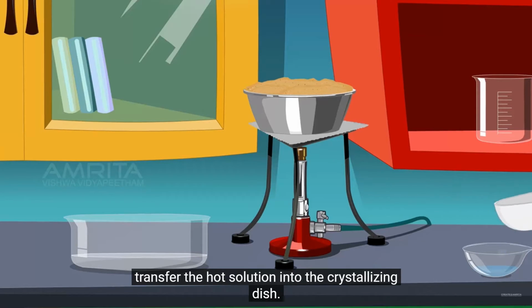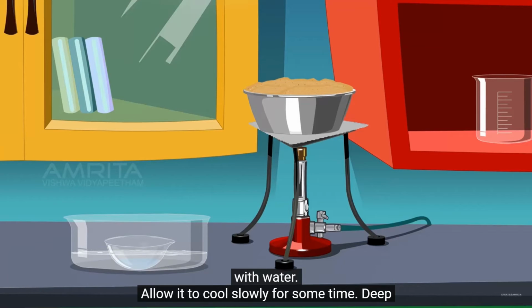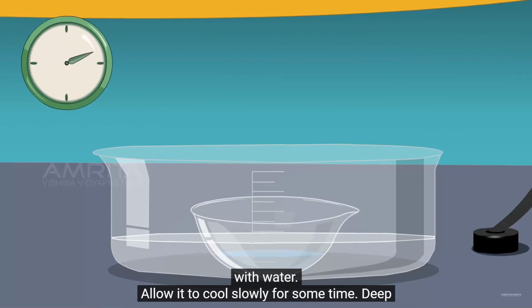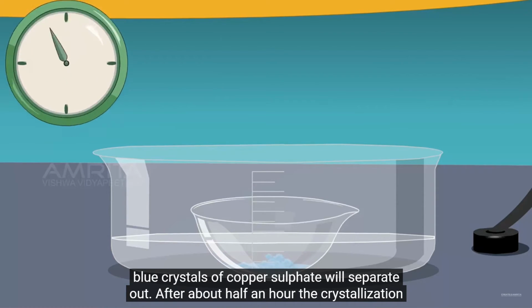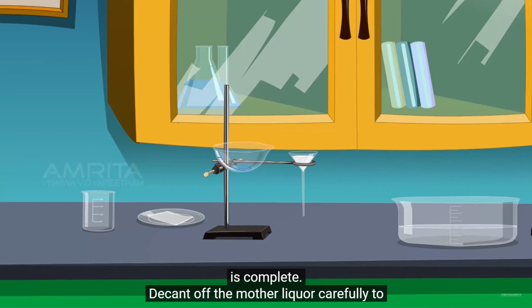Transfer the hot solution into the crystallizing dish. Place the crystallizing dish containing hot saturated solution on the trough half filled with water. Allow it to cool slowly for some time. Deep blue crystals of copper sulfate will separate out after about half an hour, when the crystallization is complete.